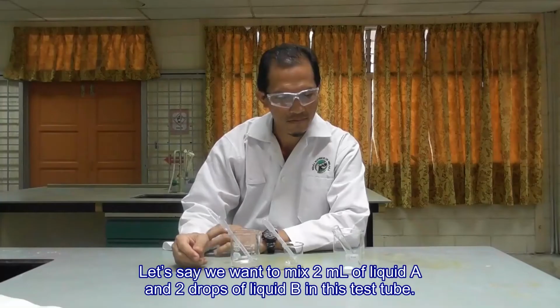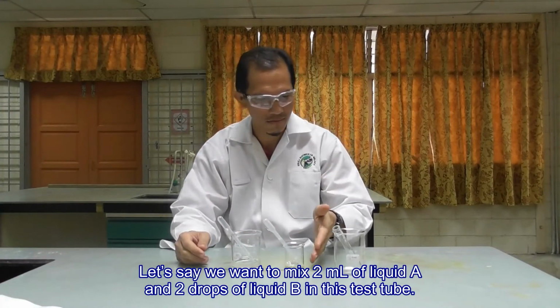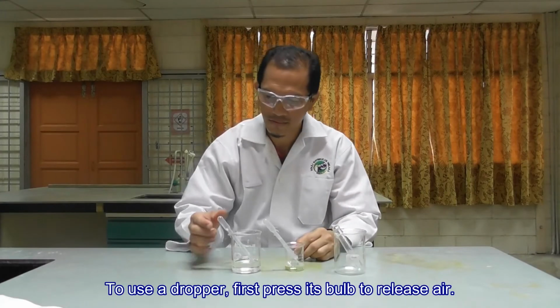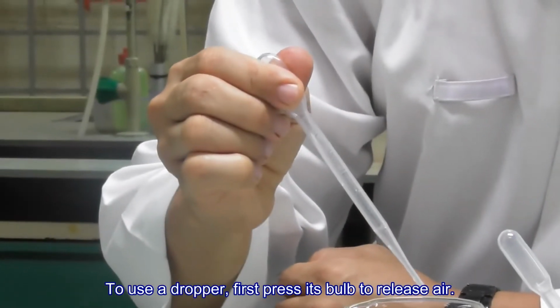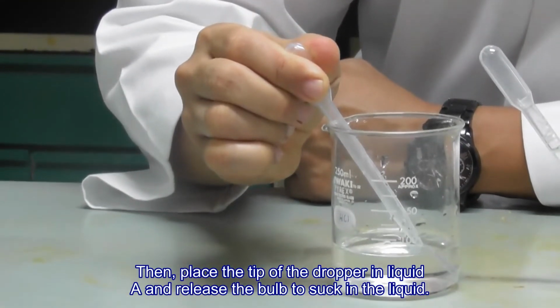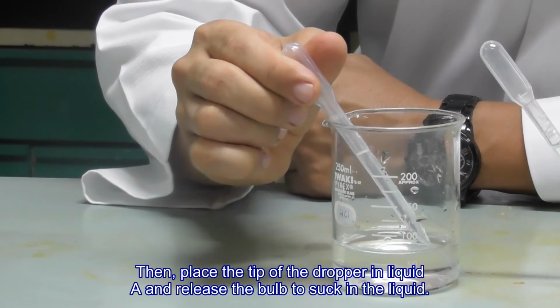Let's say we want to mix 2 ml of liquid A and 2 drops of liquid B in this test tube. To use a dropper, first press its bulb to release air. Then, place the tip of the dropper in liquid A and release the bulb to suck in the liquid.